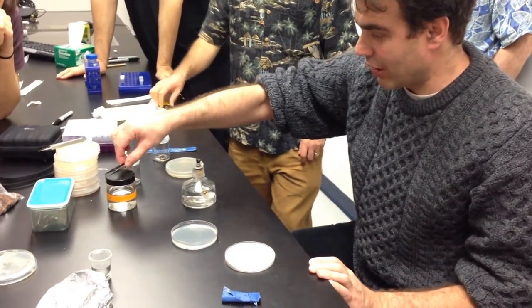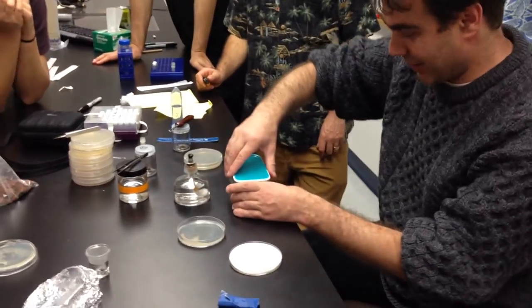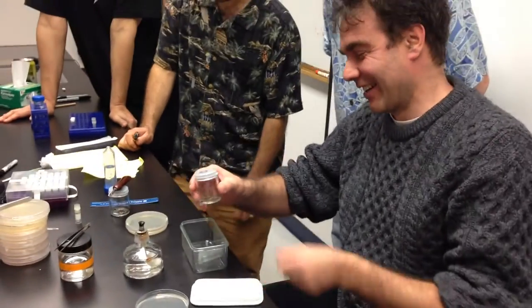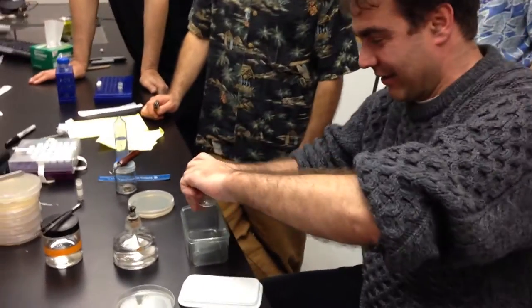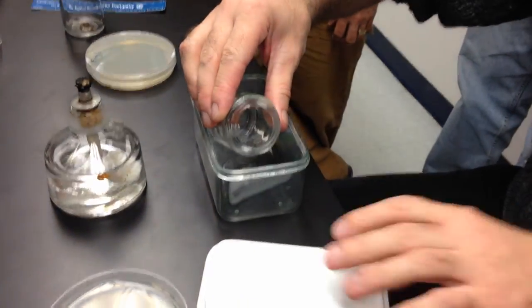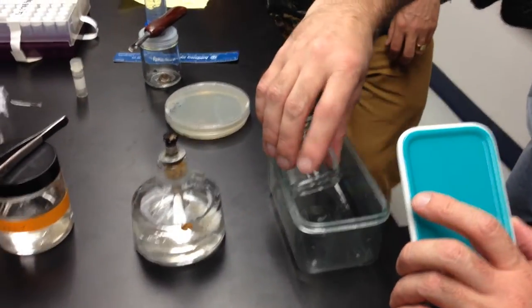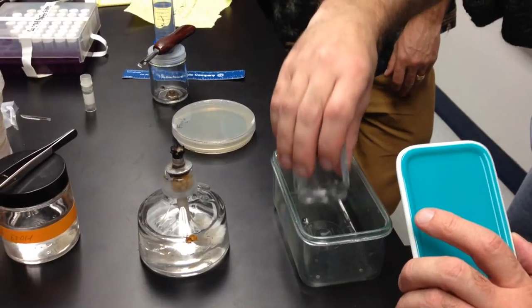Next is the most tragic moment — you remove poop from the owner. It's already happened. You got a close-up of the little guy. Come on. Jump! We'll release you, I promise. Release you back to natural habitat.